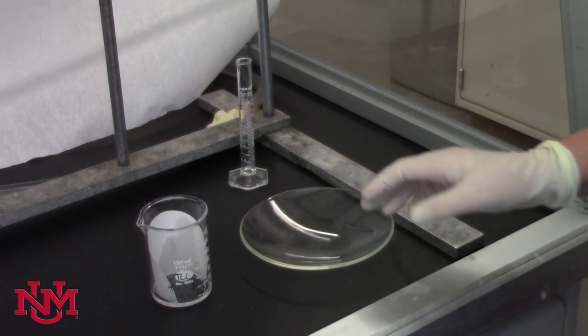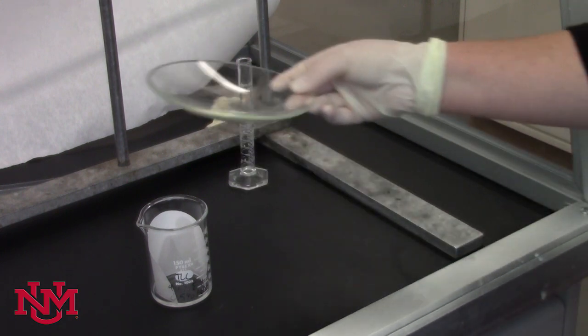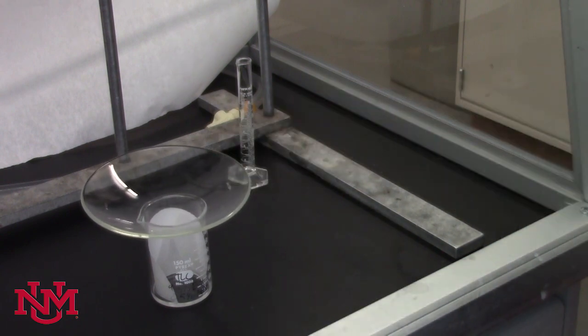Finally, to make sure that this is entirely saturated, you'll take a watch glass and put it on top so that it's nice and sealed.